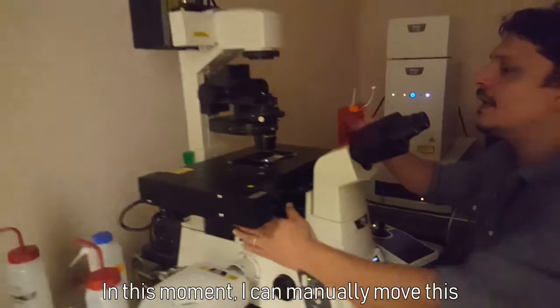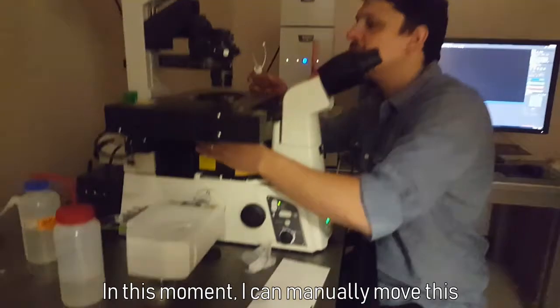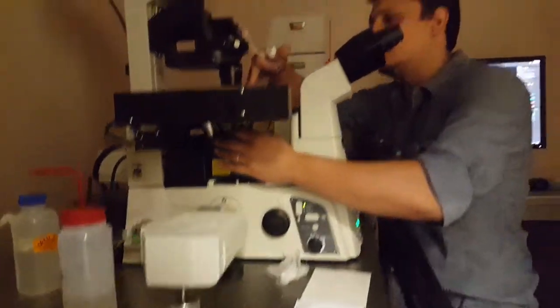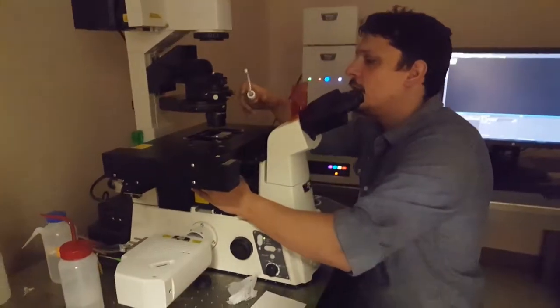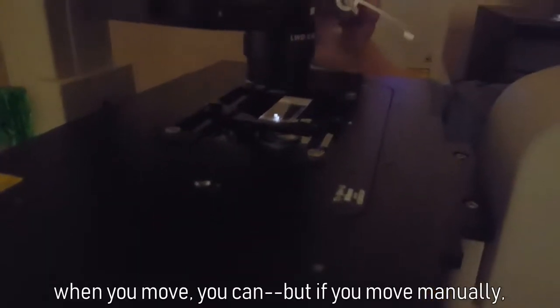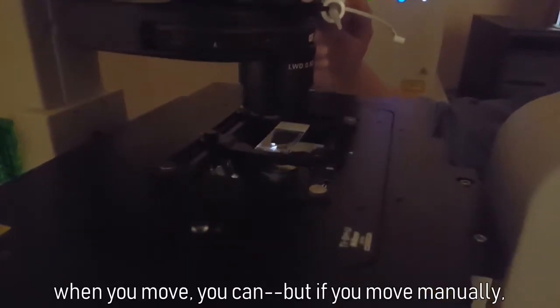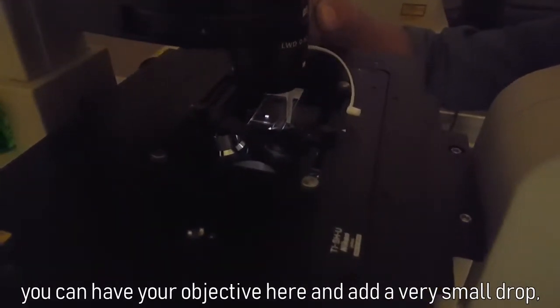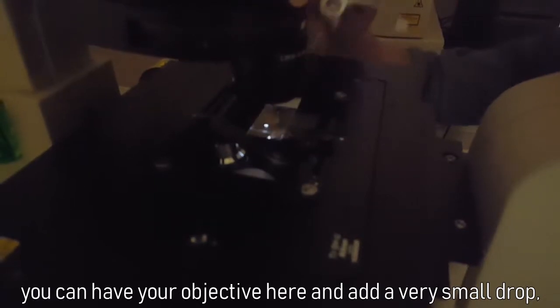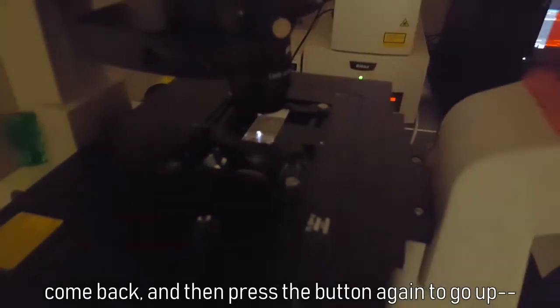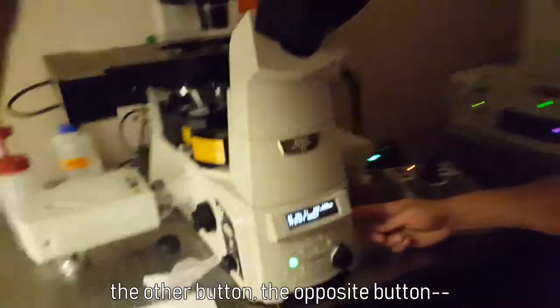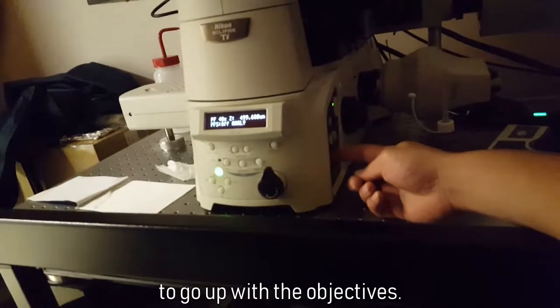In this moment, I can manually move this. And for example, you can focus here. When you move, this is the good place. But if you move manually, you can have your objective here and add a very small drop. Come back, and then press the button again to go up, the other button, the opposite button, to go up with the objectives.